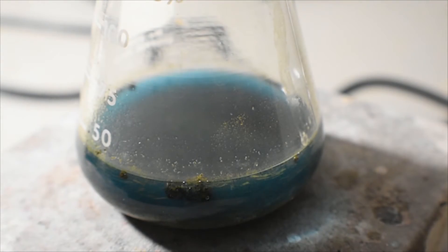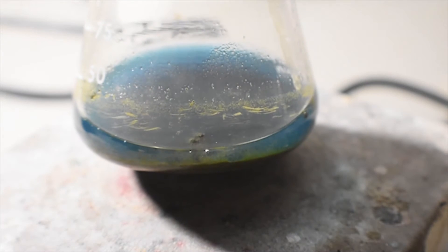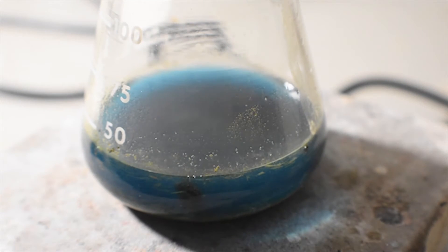So what's happening here is the aforementioned cobalt-2-triphenylphosphine chloride complex forms an intermediate and highly unstable complex with the sodium borohydride. This then is reduced further down to cobalt-1, which we saw as the brown powder at the bottom of the Erlenmeyer flask. As we can also see, there is a blue color remaining, which means there is unreduced cobalt still in solution. So I'm going to add further borohydride until it is nearly colorless.